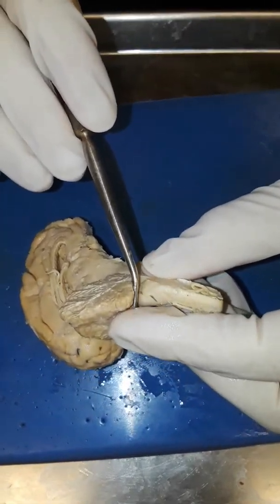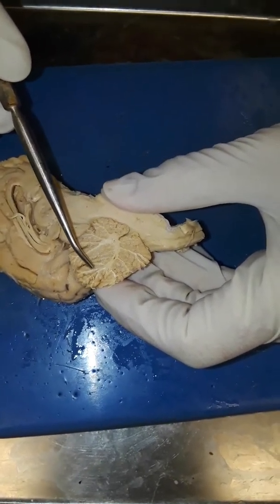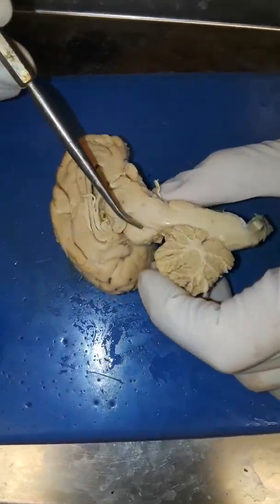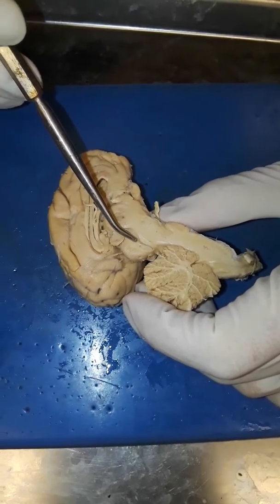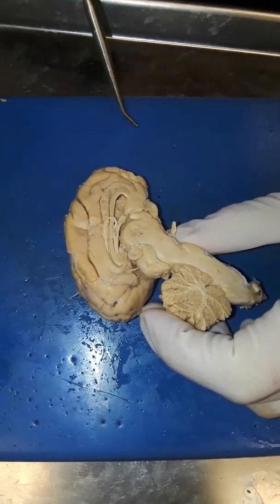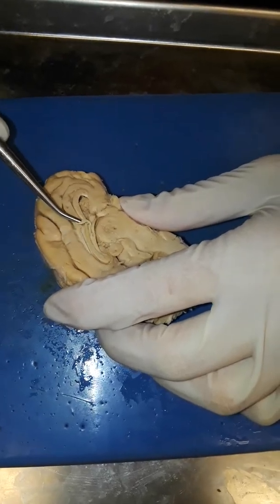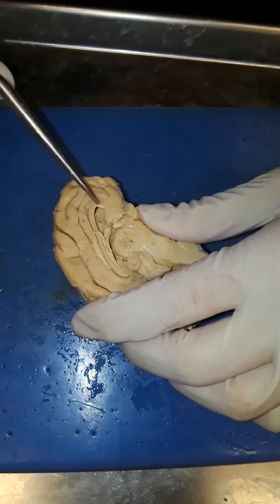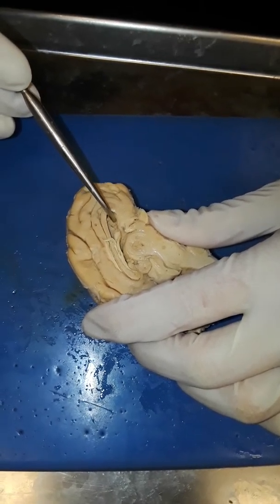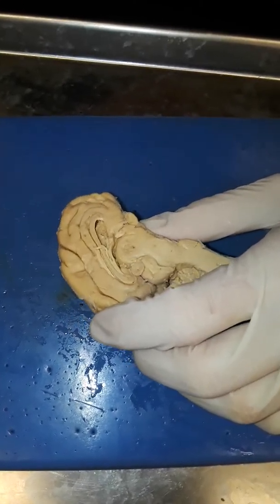The arbor vitae of the cerebellum — that's the tree of life right here. The corpora quadrigemina is right here. The anterior colliculus is right here and the posterior colliculus is the posterior one. The corpus callosum is that whole big swirly thing in the middle. The genu is most anterior, then you follow the trunk back to the splenium, and then going back forward you end up at the fornix.